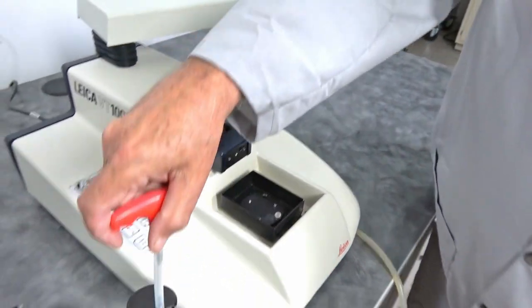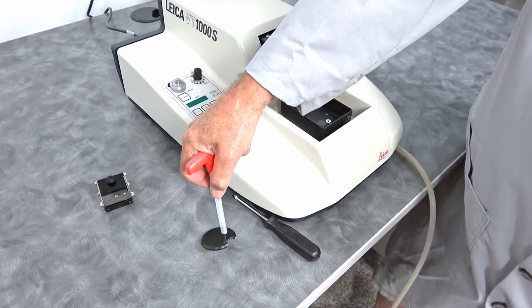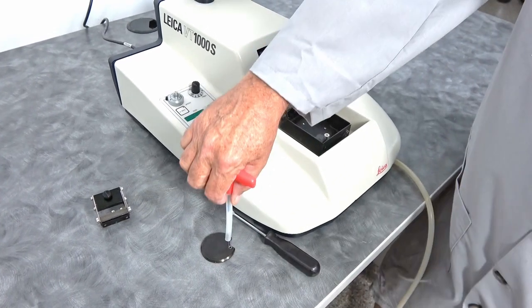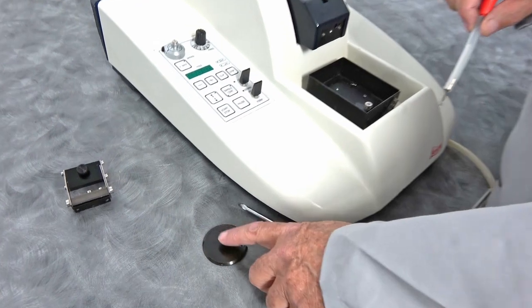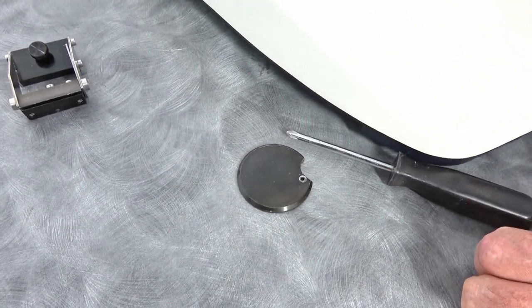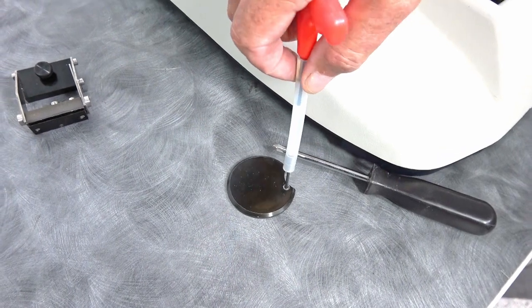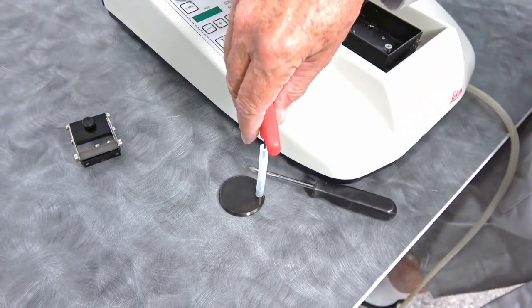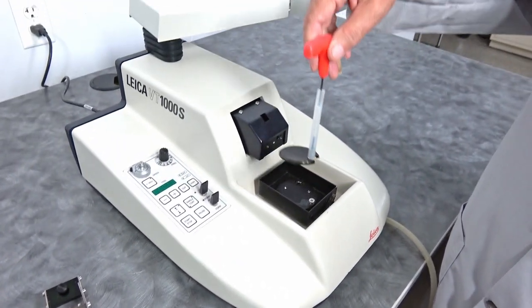Once you have that, it's able to be pulled up and you can release your sample. You adhere a sample onto your specimen disc. That requires a particular glue, which is mentioned in the listing and in the manual. Just by putting that on there, now it holds well into place.